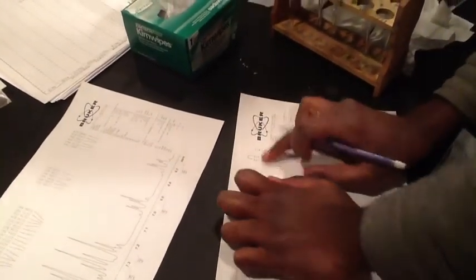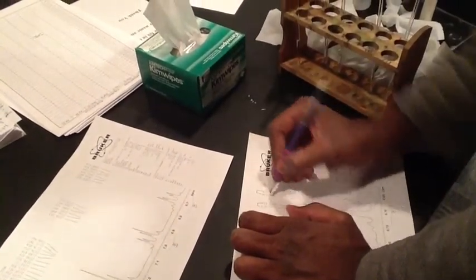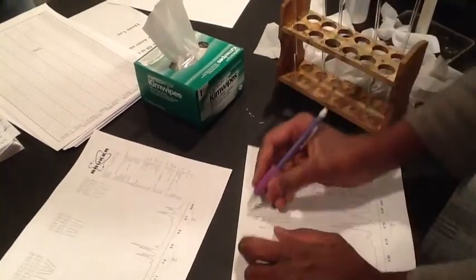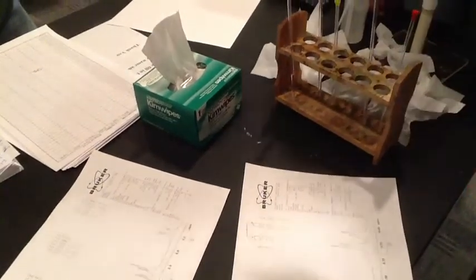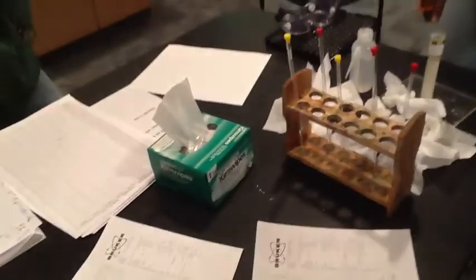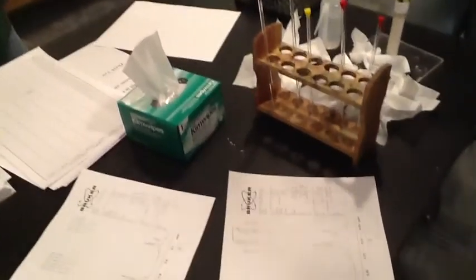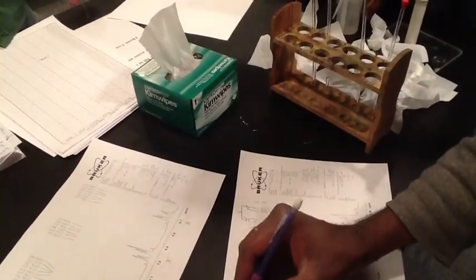Those two numbers are already in hertz values. You just have to subtract them. But here you have a minor splitting, so take the average of this and the average of that, and then just do the subtraction. The difference between those two averages will be your J value. The same thing with this: average, and then difference. So that will be your J values. Oh, you are next? Yes. Okay.